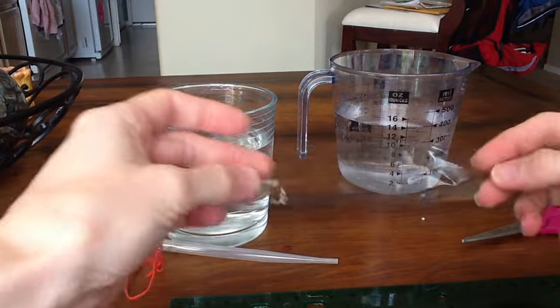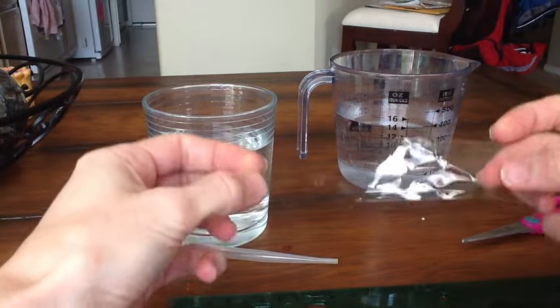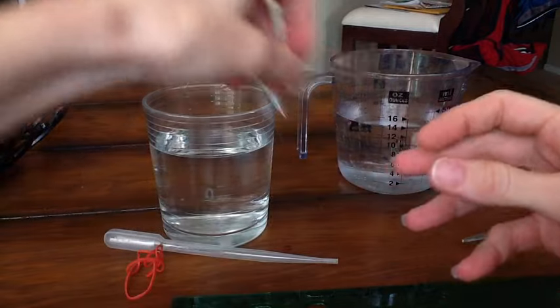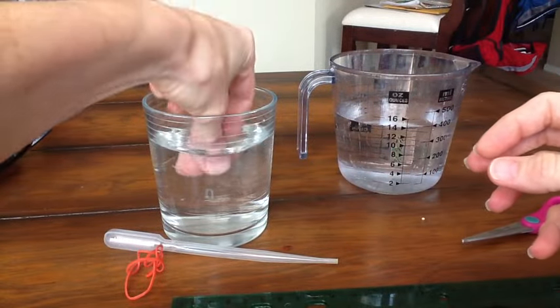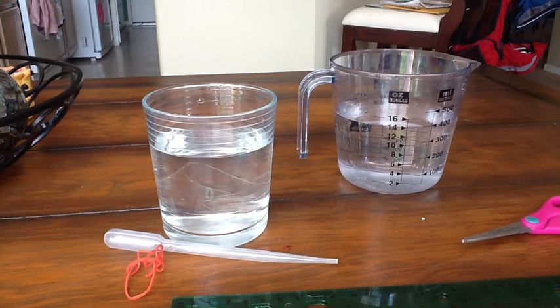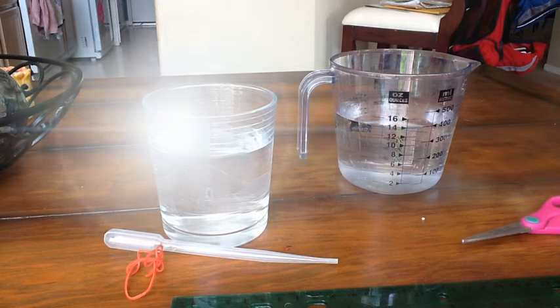So I'm just going to make this cut here so I have about 12 centimeters. And right now it's flat. It's not a tube at all. You can see the edge here. It's almost sealed together and this is actually a tube. So what we're going to have to do is we're going to have to place it in this water here and we're going to let it sit in here for about two to three minutes.